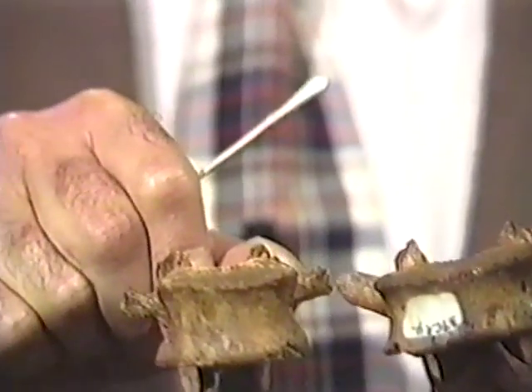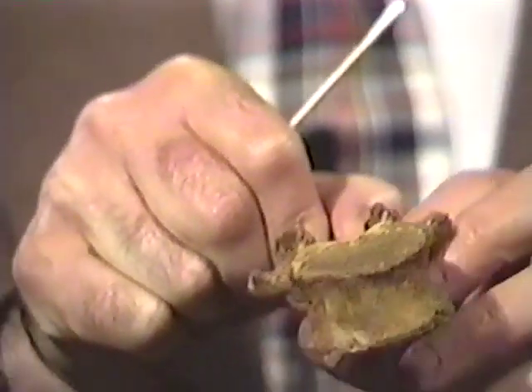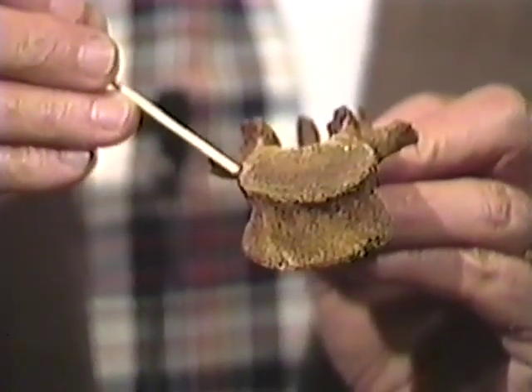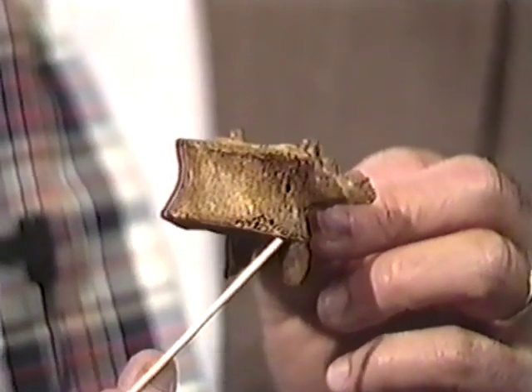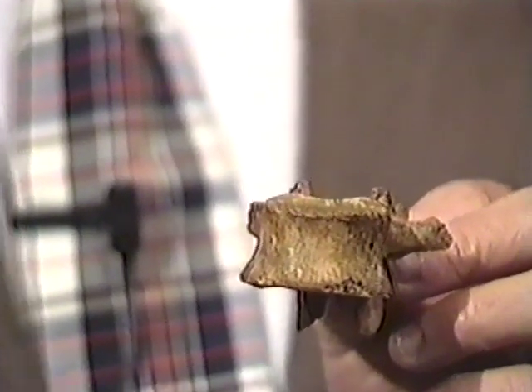Here we have an individual in which the epiphyseal rings have attached, and you will see there the ring, and you cannot see the beveling that occurs when the ring is not there. And this is an individual that, note, has nice smooth edges around the edge of that bone right there. Now, let's go to another one and show you.